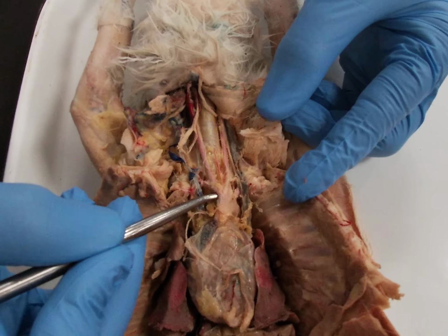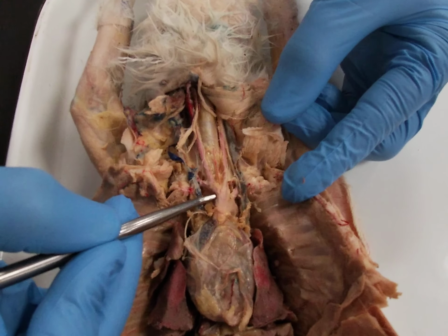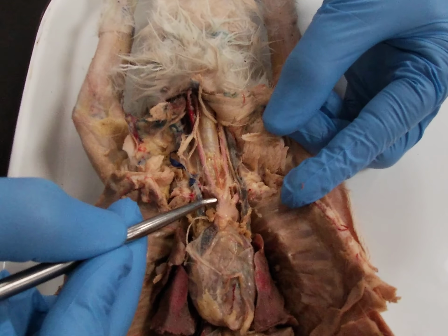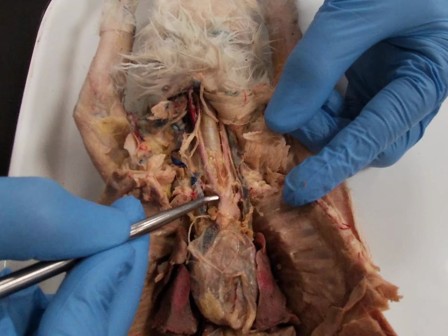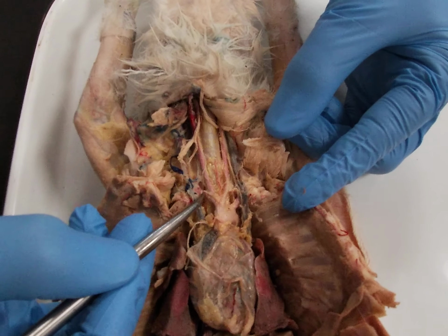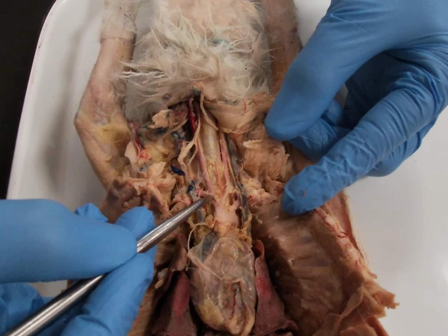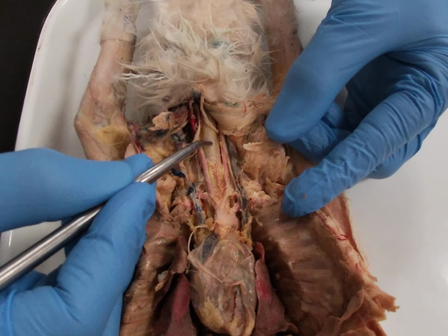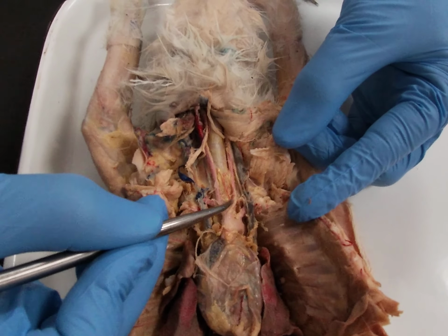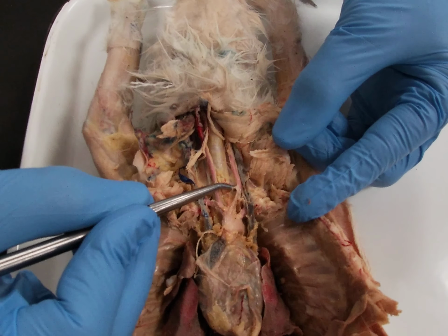Now, brachiocephalic means arm and head, so you would expect the vessels that branch off the brachiocephalic go to the head and to the arm. When I pick up the brachiocephalic trunk, you can see the vessels that branch from it. And so let's describe those vessels. This first vessel here going off into the rabbit's arm, this is your right subclavian artery. This vessel tracing up the right side of the trachea, this vessel is known as the right common carotid. And this vessel tracing up the left side of the trachea is known as the left common carotid.